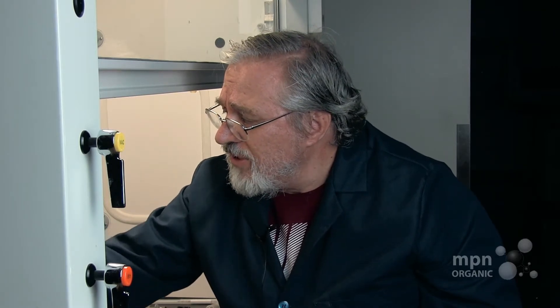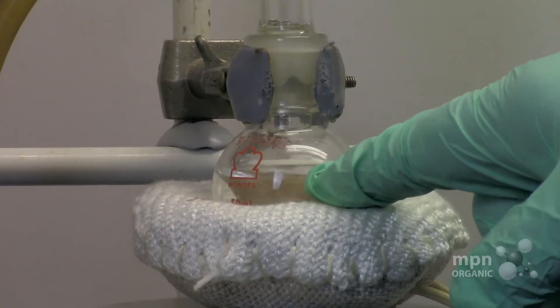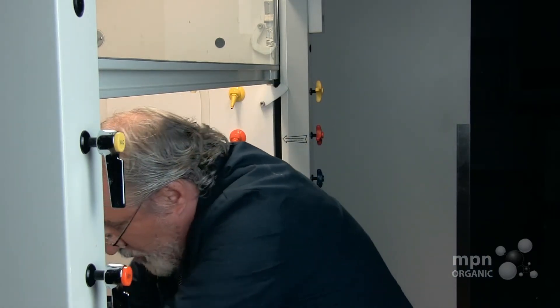This constant vaporization, condensation, and return to the liquid state keeps the temperature constant, but also prevents the acetone from vaporizing out the top. That's the charm of the whole thing — you keep the volume constant and the temperature constant. And that's what you need to know to perform this operation, and that's how you set up the condenser.